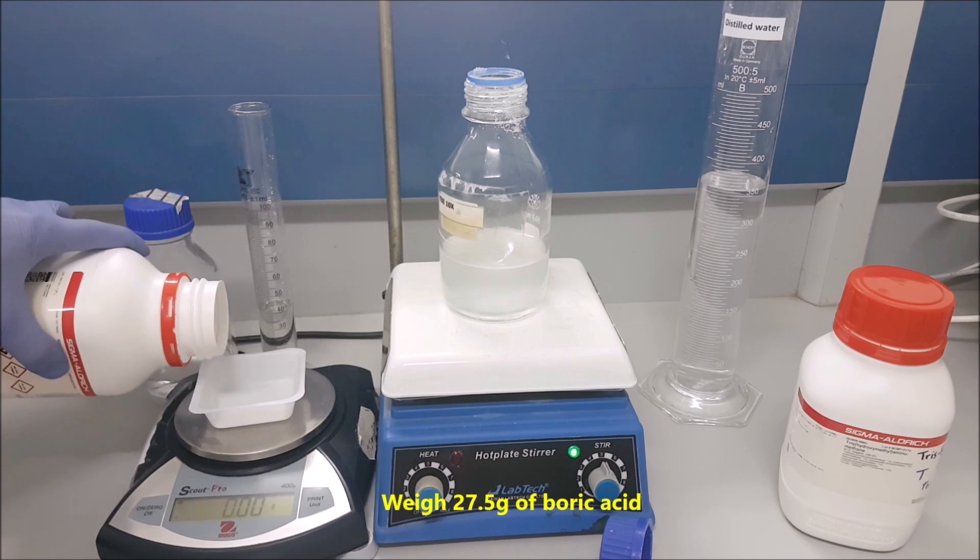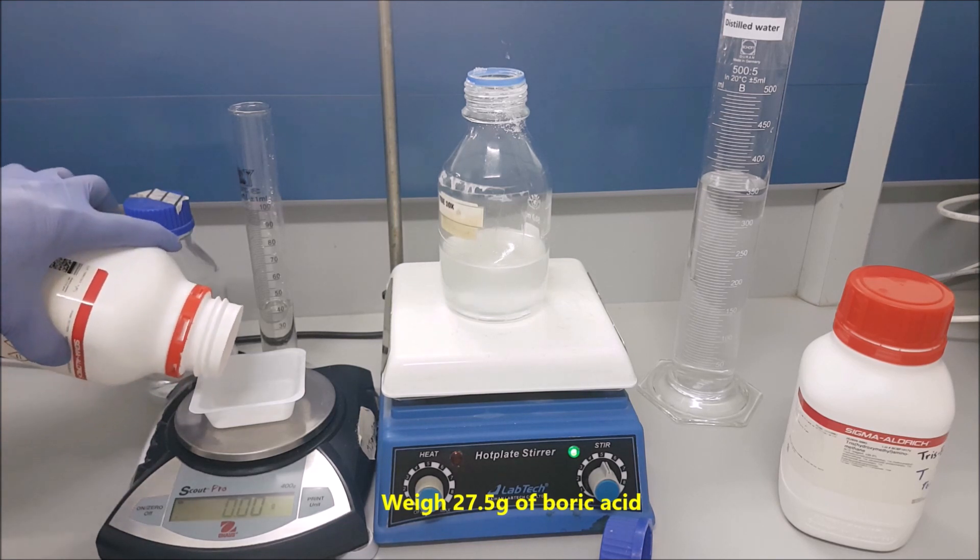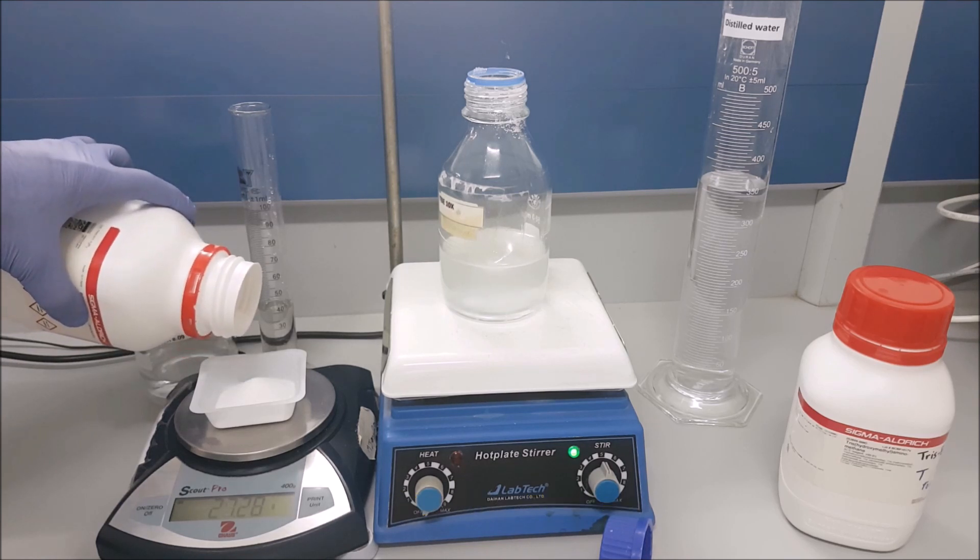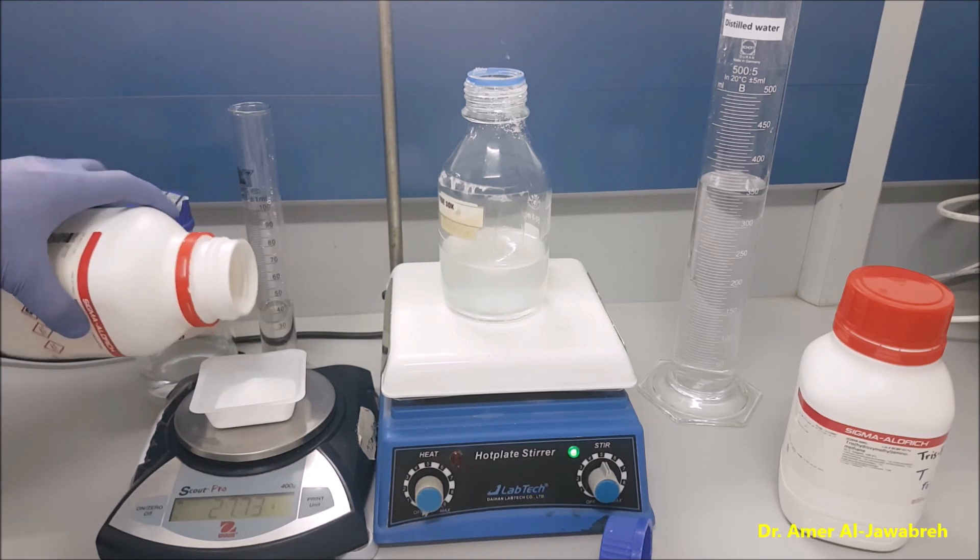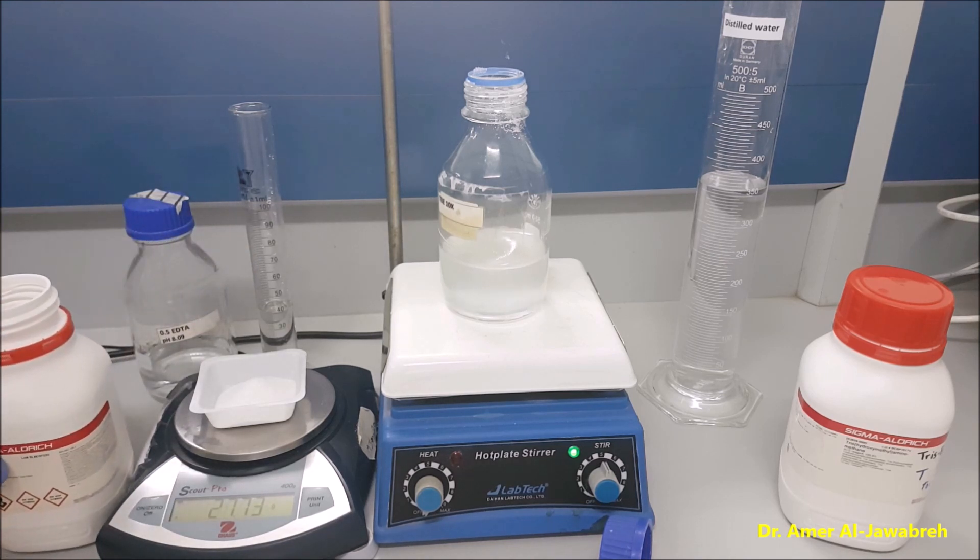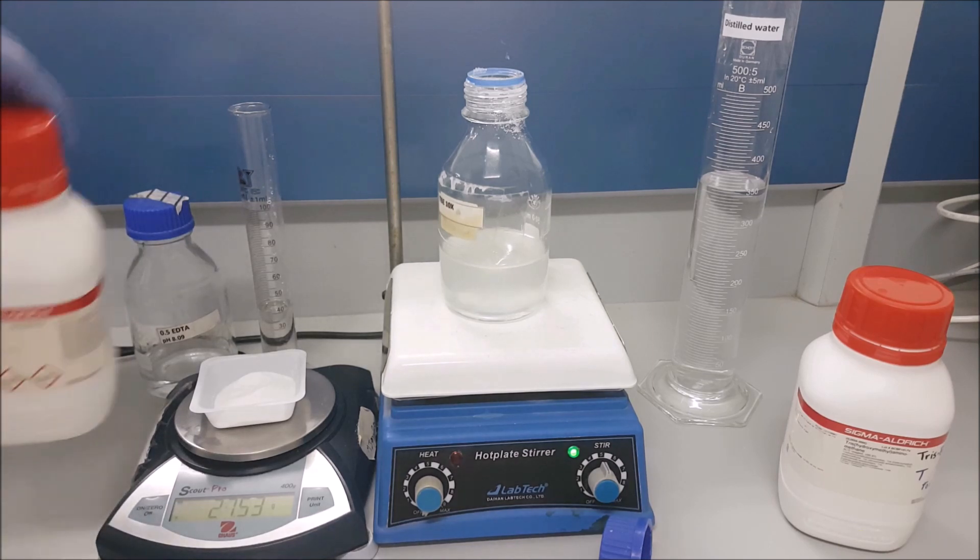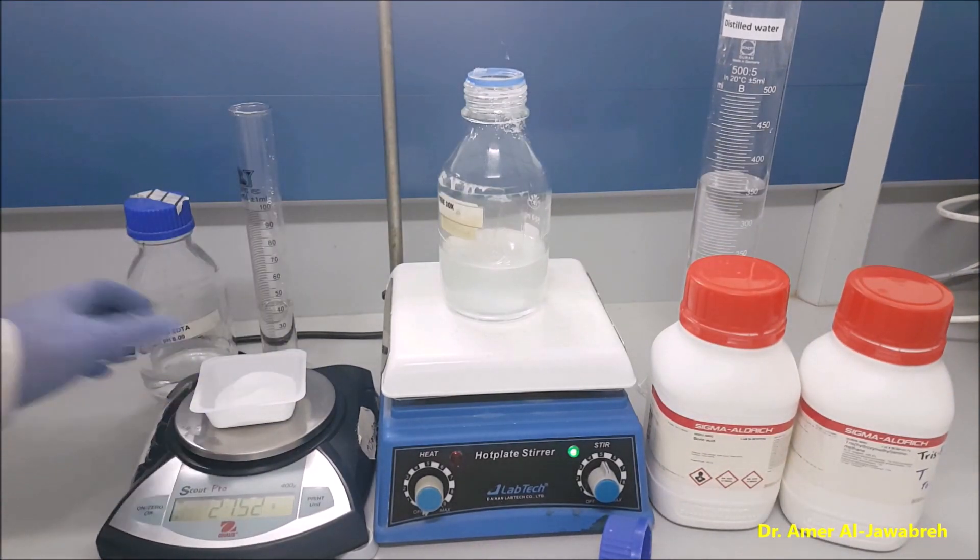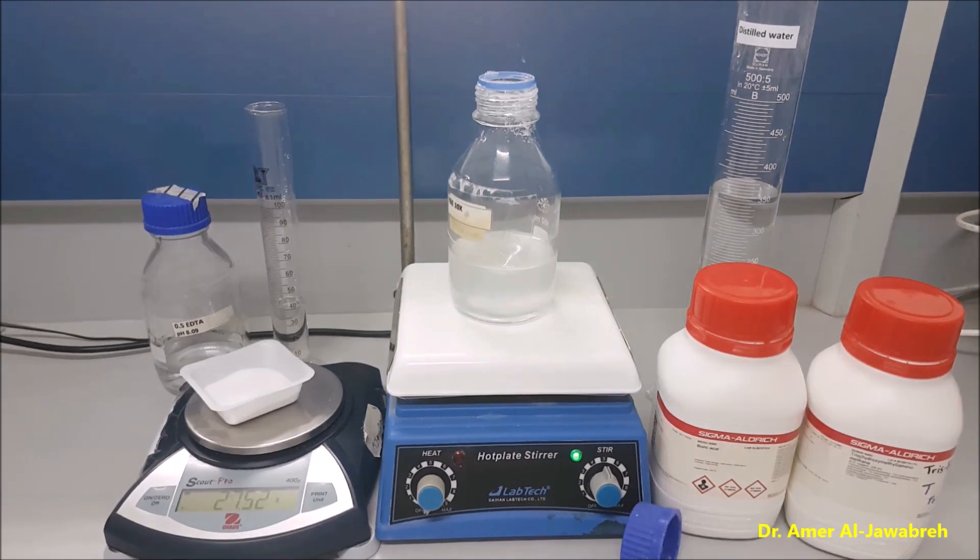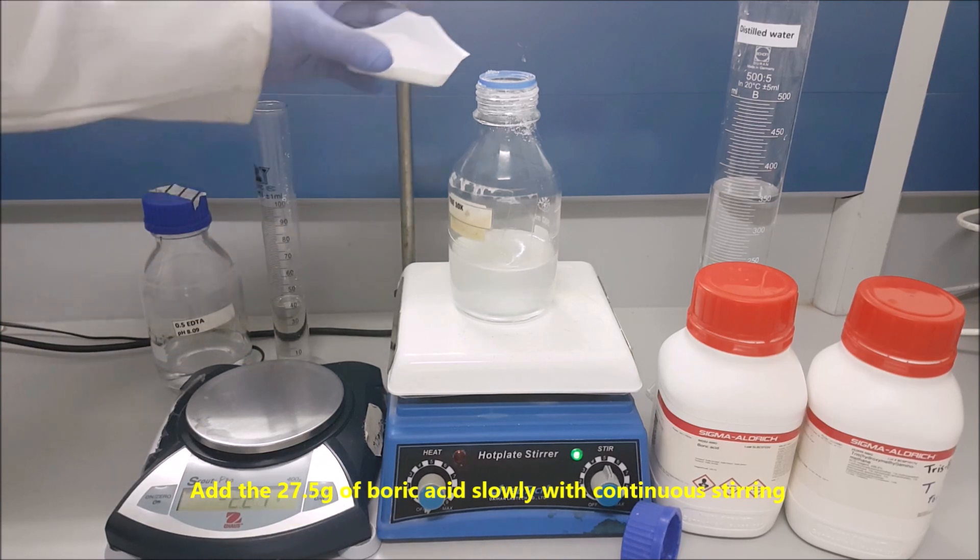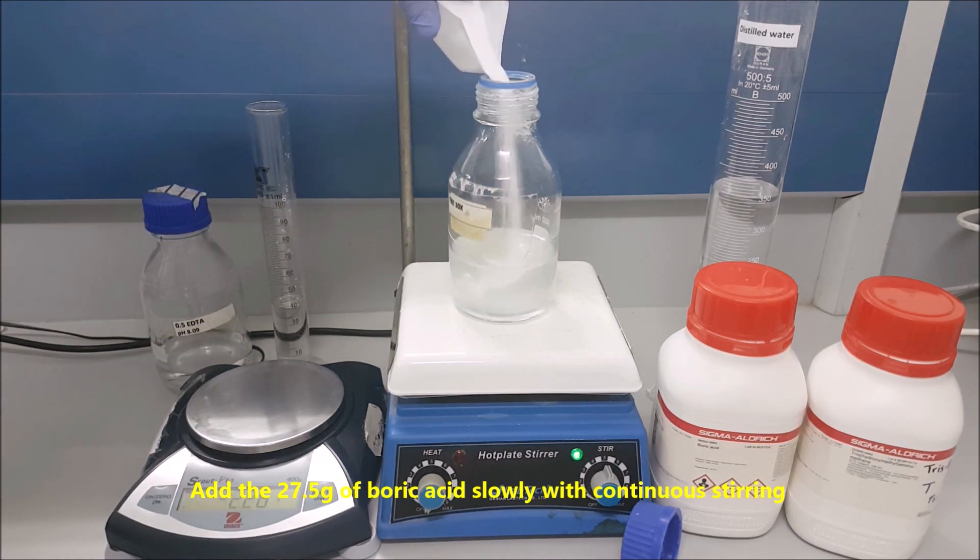Weigh 27.5 grams of boric acid. Add the 27.5 grams of boric acid slowly with continuous stirring.